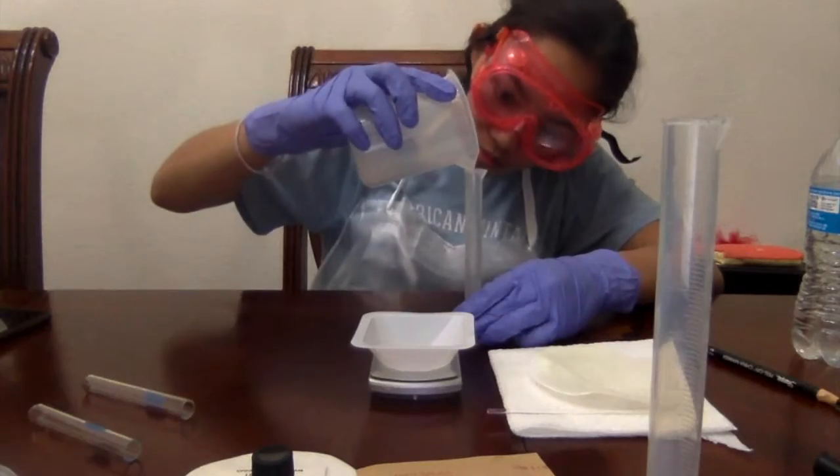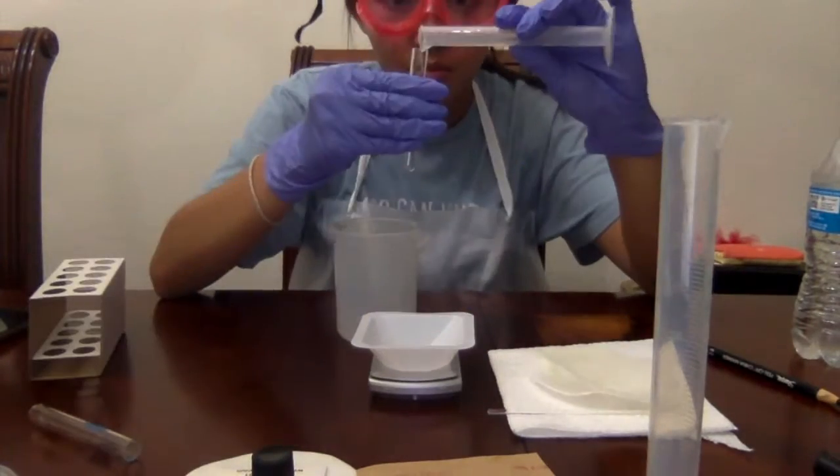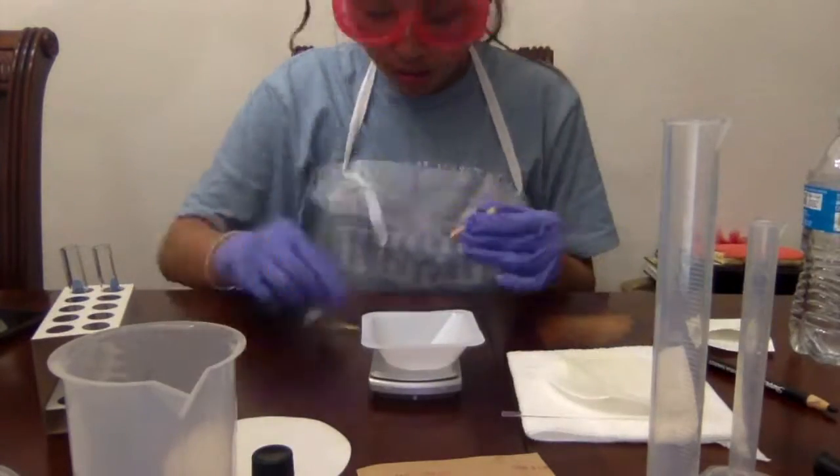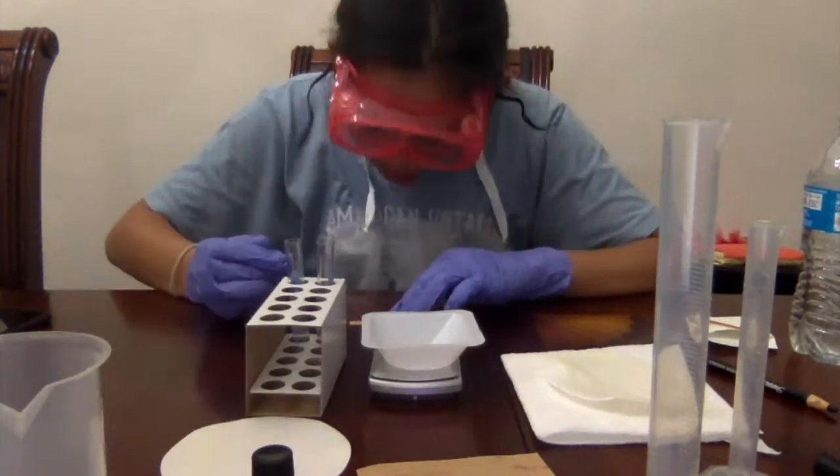Finally, in test tube 2, hard water was added to the soap solution combined. Here, the solution produced very much less foam and was a more cloudy, solid form of water solution.